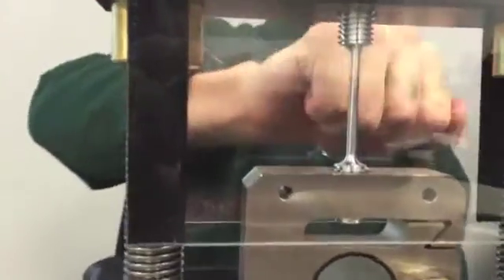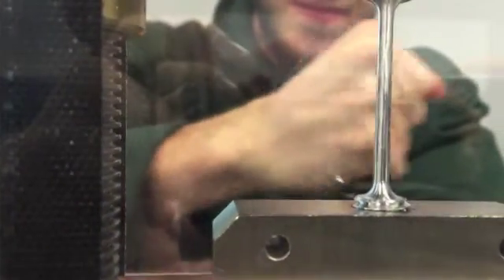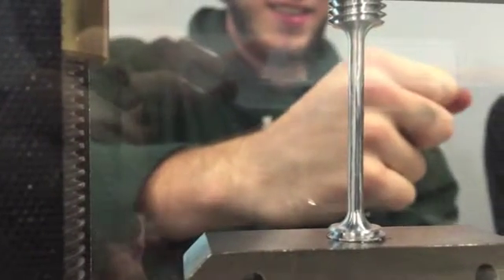Alright, so the next test specimen we've got here is aluminum. And this aluminum piece actually elongates a good bit before it begins to neck and then break. Alright, here we have the slow motion for the aluminum test sample. It's hard to tell, but it actually elongates a good bit before any necking begins. And once necking begins, there's not a whole lot right before it fractures.